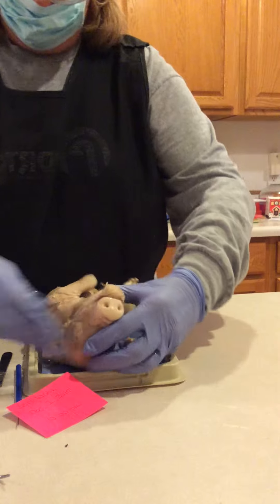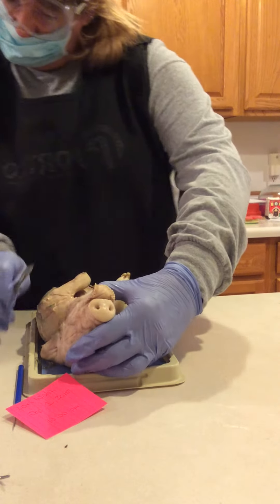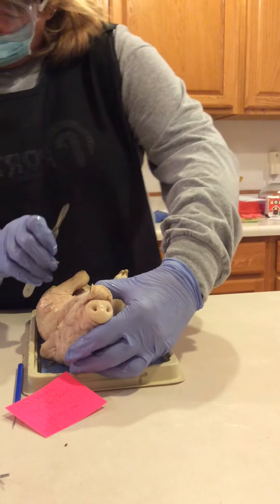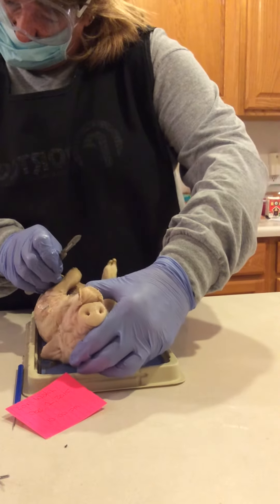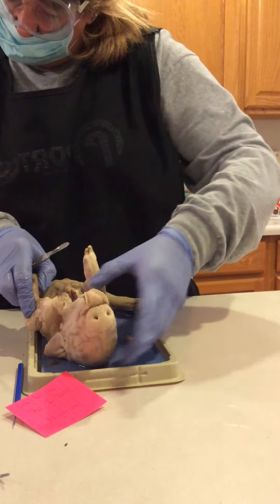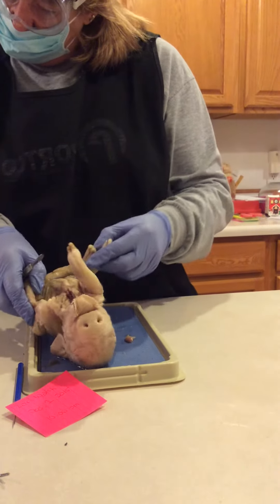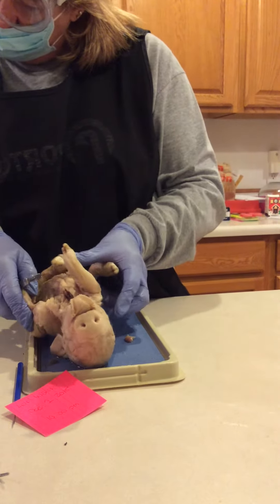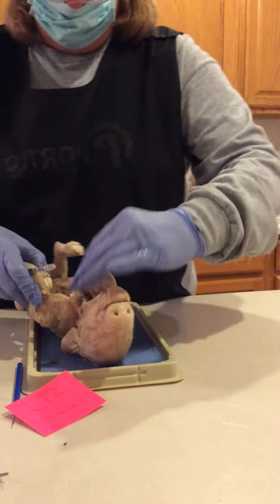Okay, here it is. Open the thoracic cavity by cutting through the sternum and cutting away the ribs.